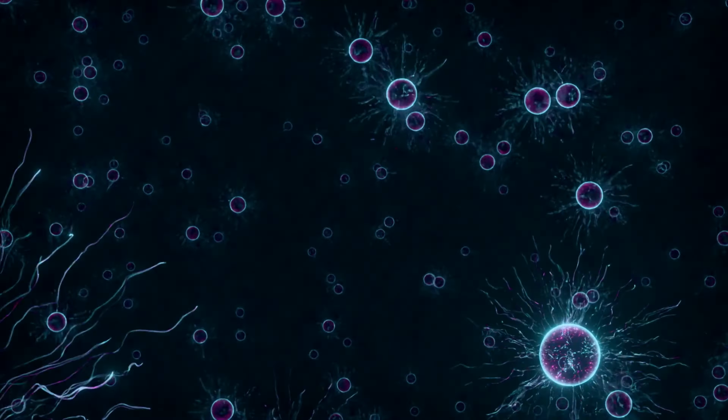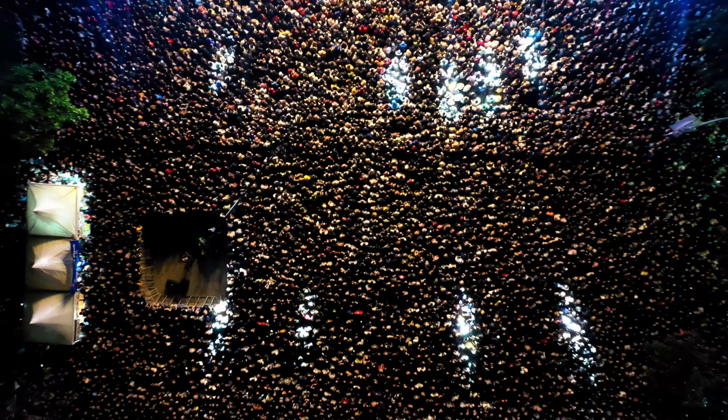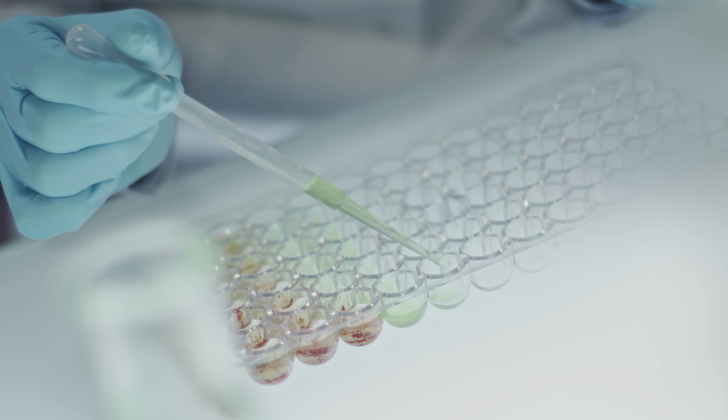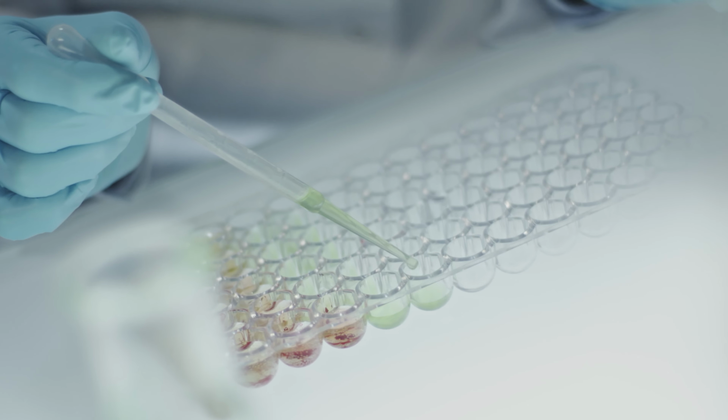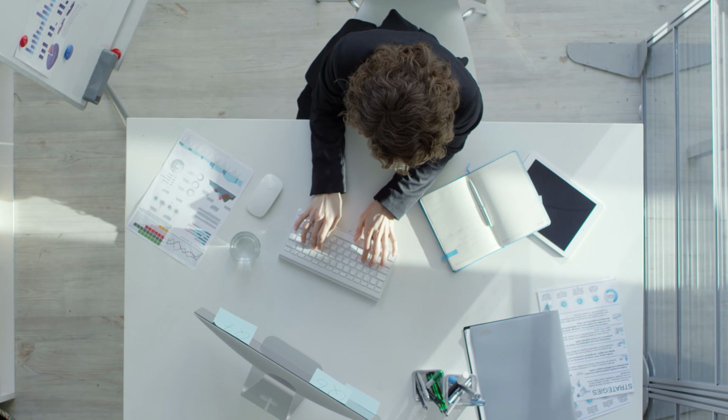Circadian rhythm research is key to understanding sleep disorders and neurological diseases affecting millions of people around the globe. But scientists face a massive bottleneck. They must analyze thousands of neuronal cells across days of imaging data, manually tracking their activity frame by frame. What could be taking them minutes is currently taking them hours to days.